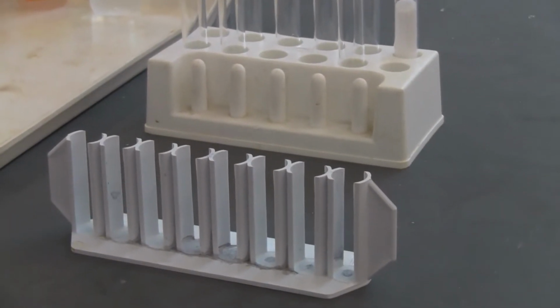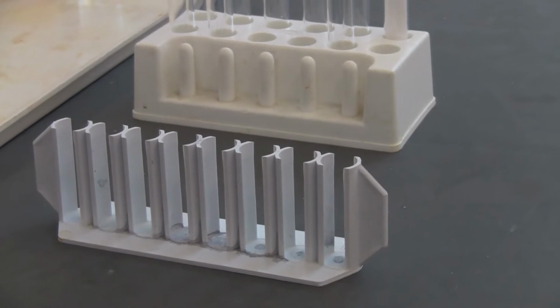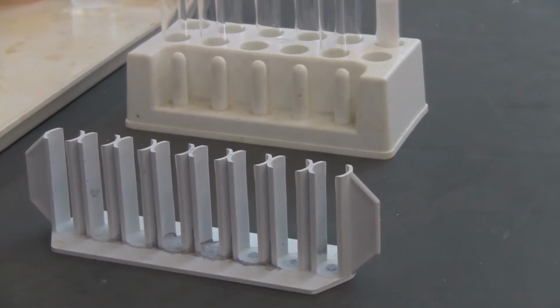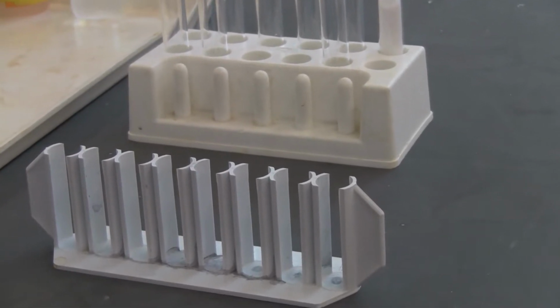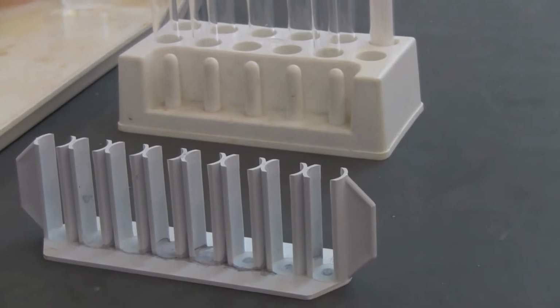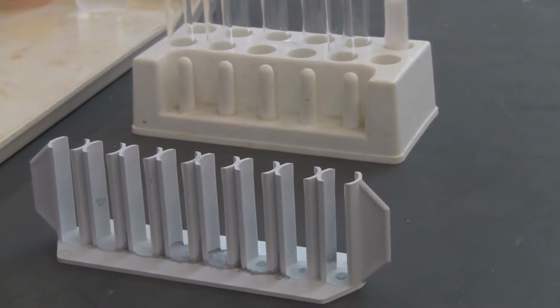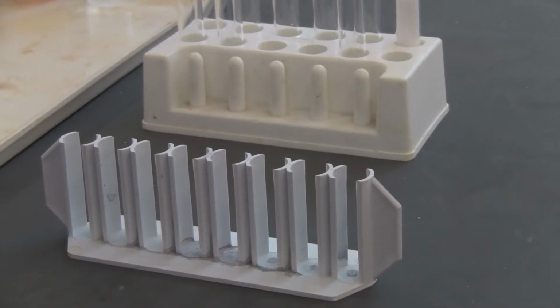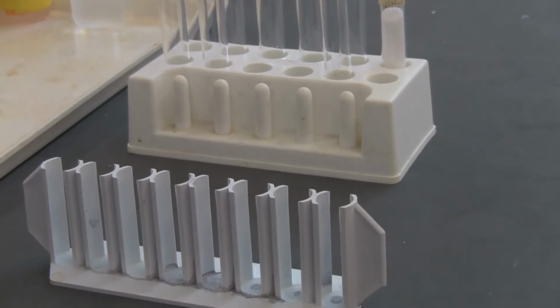Here's the first part of our chemical reaction equilibrium lab. You're going to watch the video again. I'm going to pause very often to answer questions in the worksheet, in the lab data sheet. The first part is to study what factors will influence our reaction rate and in what way.